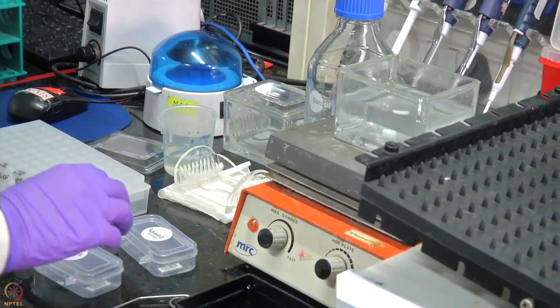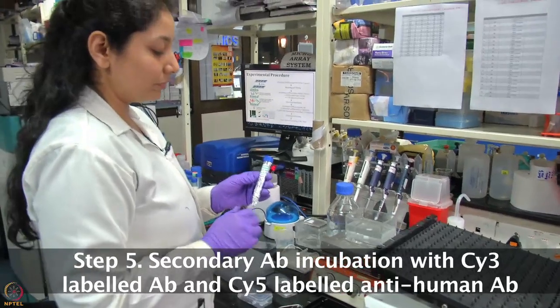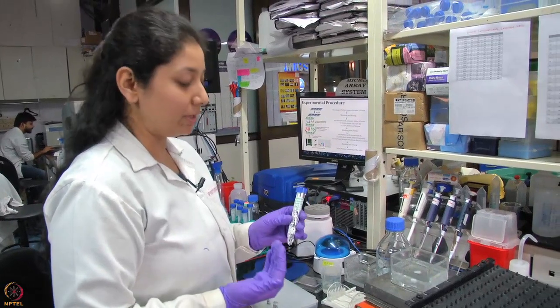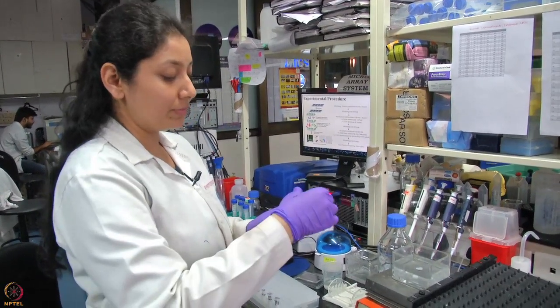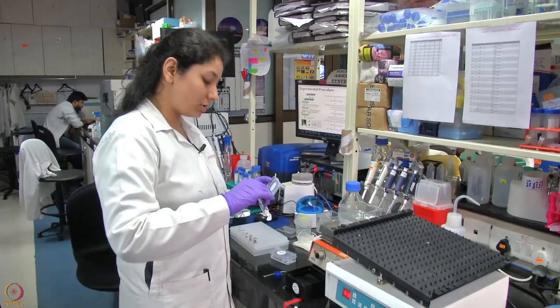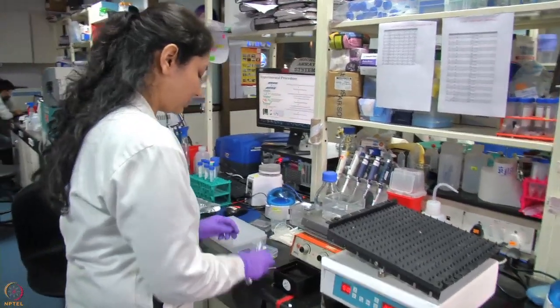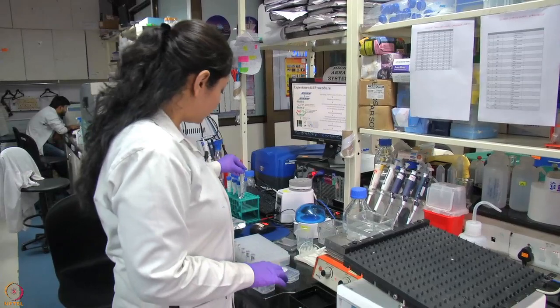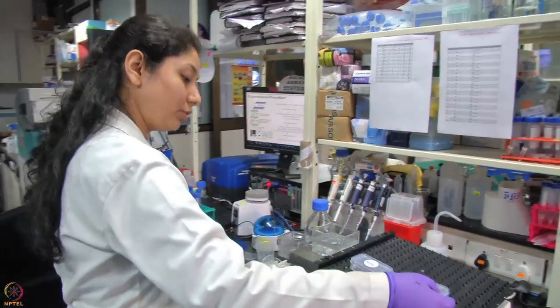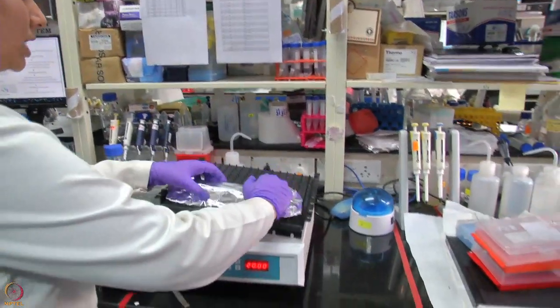The secondary antibody mixture is a light-sensitive reaction. It contains Cy3 antibody which is anti-rabbit, anti-GST antibody, and Cy5-labelled anti-human antibody. We place the solution onto each chip. Since this is a light-sensitive reaction, make sure the slides are covered with aluminium foil or a black box so that light does not interfere with the reaction.